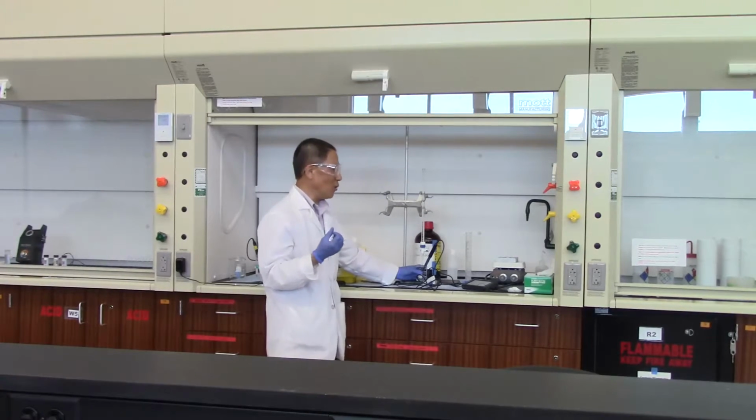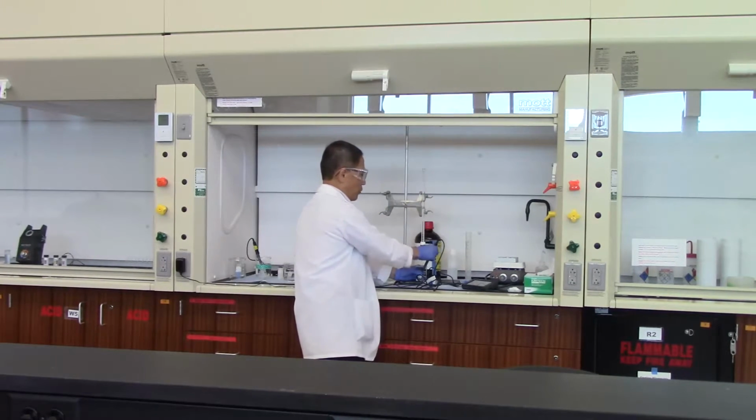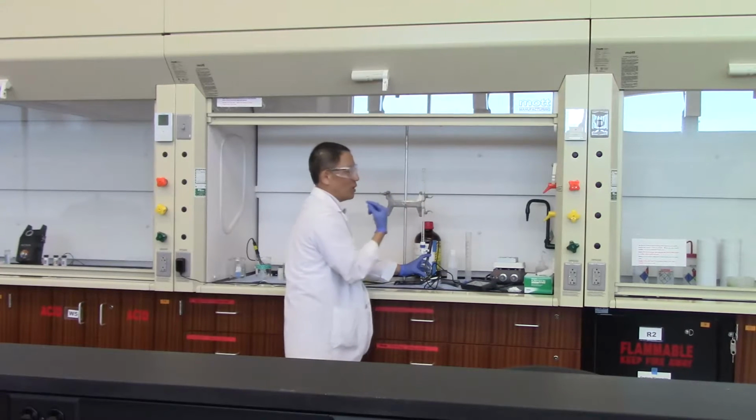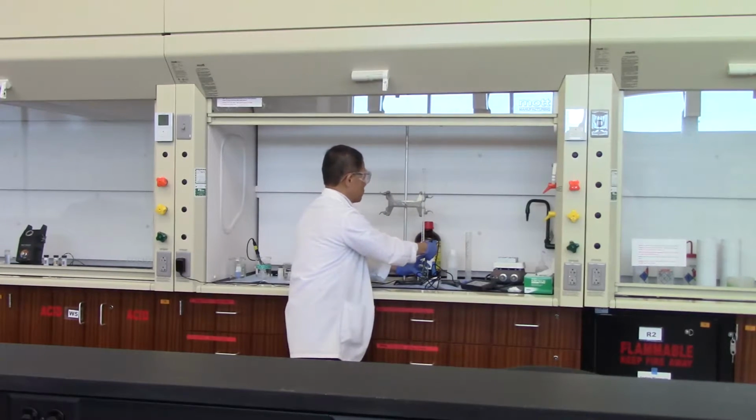And we will see how much it takes in order for the pH of the buffer solution to jump up to 6. Okay? Your lab manual asks you to add the sodium hydroxide in 1 milliliter increments. So here we have the 0 milliliter reading, the initial reading for the burette.